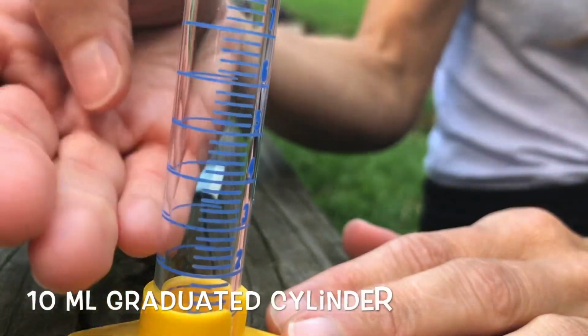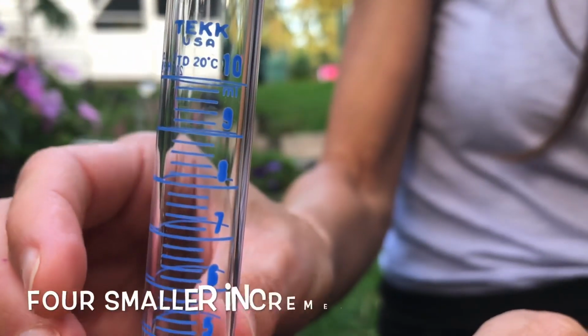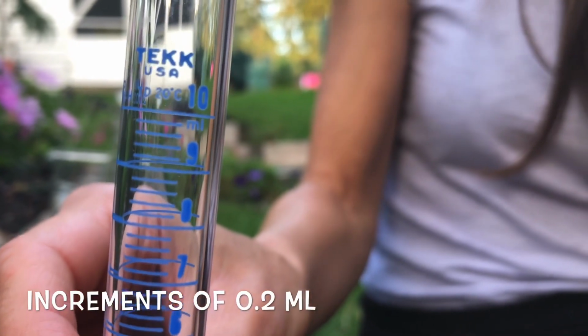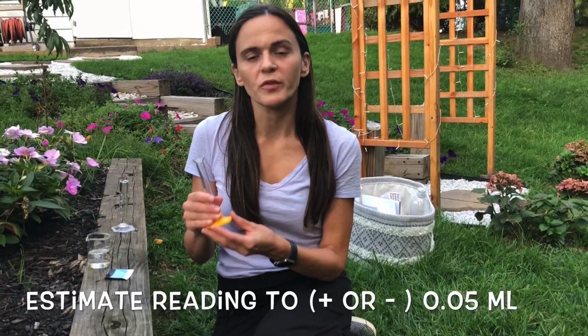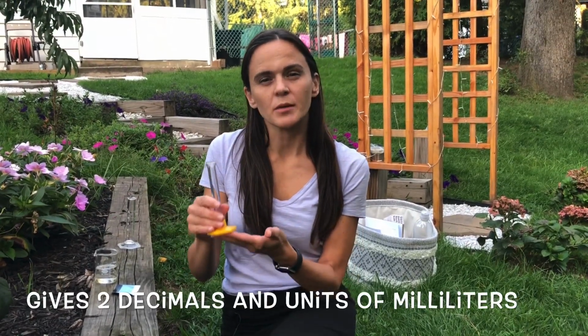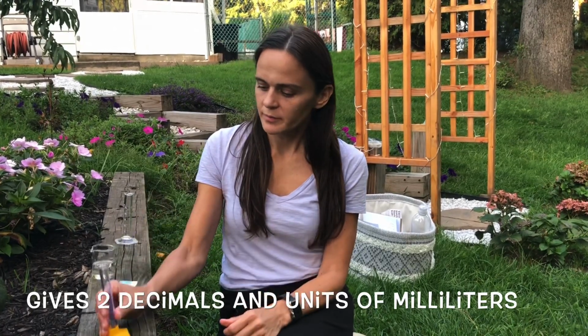Here we have a 10 milliliter graduated cylinder. If you look between the whole numbers, 9 and 10 for example, there are a total of 4 small lines or increments. Each increment is 0.2 of a milliliter. So a 10 milliliter graduated cylinder can be read to plus or minus 0.05 of a milliliter. This particular one, a 10 mL, gives you 2 decimal places and units of milliliters.